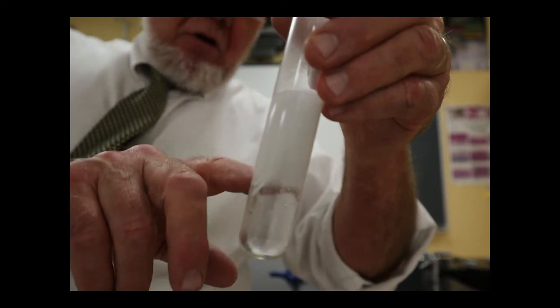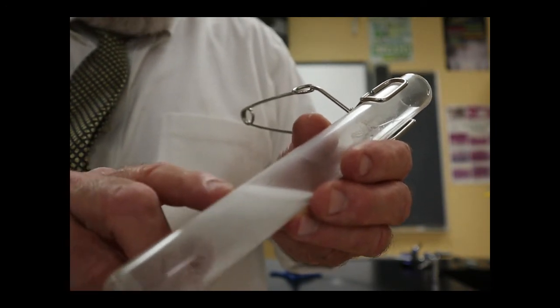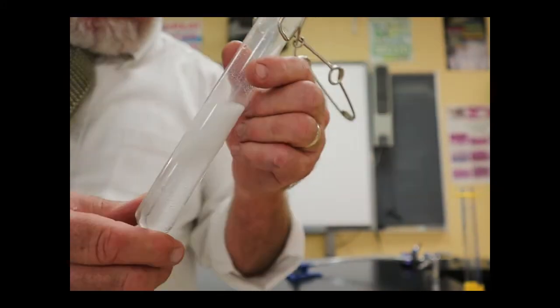But at this point, it's taking much longer than I thought and hoped. And I would have to say I really want to use a little bit more acid, or maybe stronger acid. So maybe add a little bit more acid to it. Not much. I'll try to measure out about 5 milliliters of acid. I don't want too much, but I want to make sure that all of this magnesium reacts. Add a little bit more. This means I'll have a little bit more to evaporate off, which is the unfortunate thing, that it'll take a little bit longer to evaporate off all that water. So let's see here. It's going pretty good.